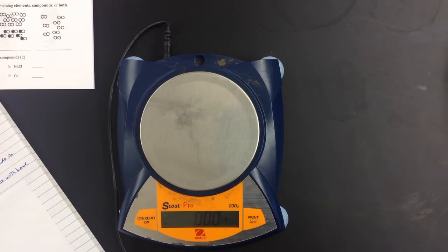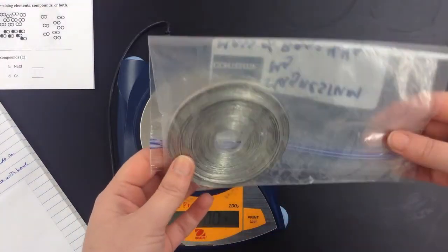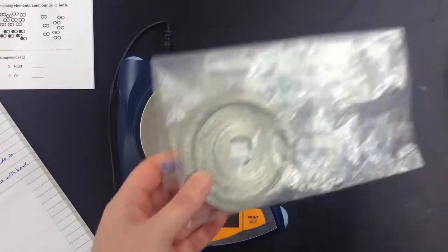Once you do that, you may find, hopefully, that the numbers are very, very close to the masses on the periodic table. That's because those are the accepted results. One mole of a substance is going to have the mass that's on the periodic table. Your numbers should match because I gave you one mole of the substance. We specifically measured out one mole of each of these elements.